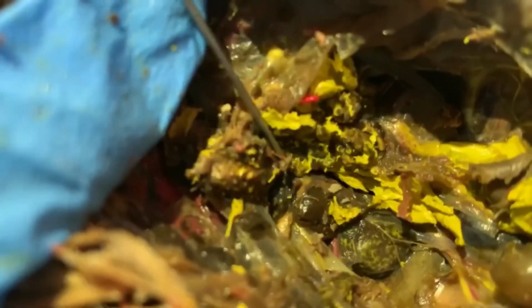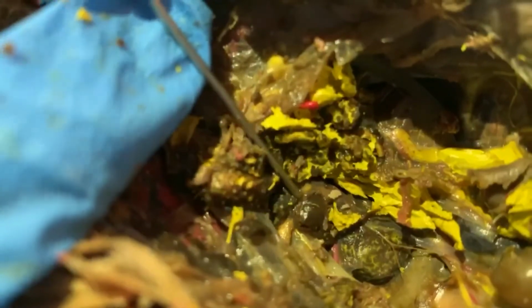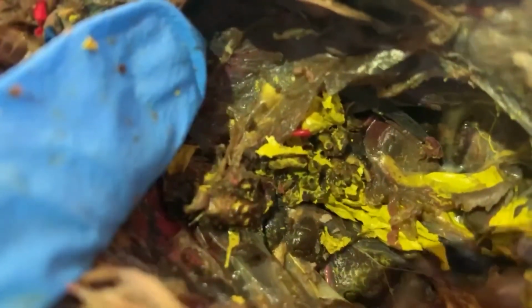Eric's pigeon is definitely a male. All this yellow stuff is basically poop. But what we have here, Ava, if you'll point out the kidneys first, these are the kidneys on Eric's pigeon, and right above the kidneys are the testes. So this is most clearly a male, while the other specimen that we had was female. The sperm would come out of the cloaca just as would the female's eggs or the poo or the urine.